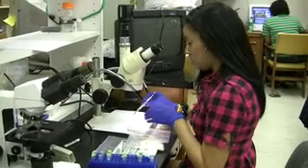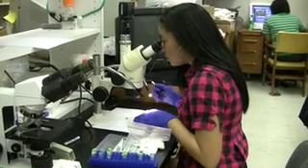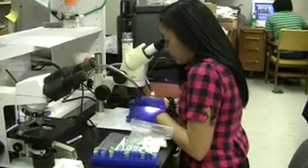I'm taking out one of the samples. I'm going to look at it under the microscope and make sure that it's clean and no epiphytes are growing on it.